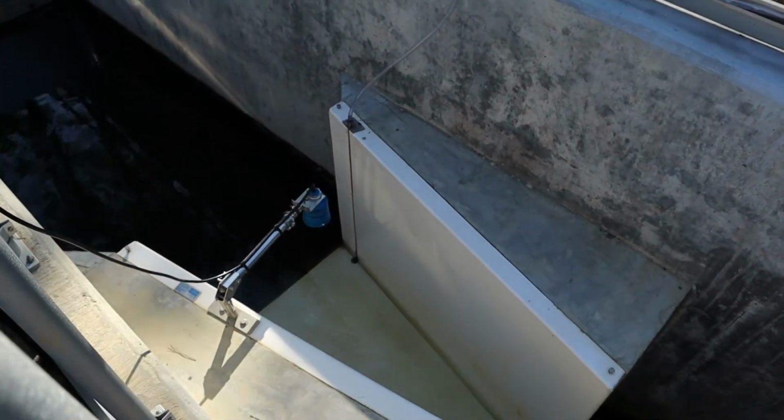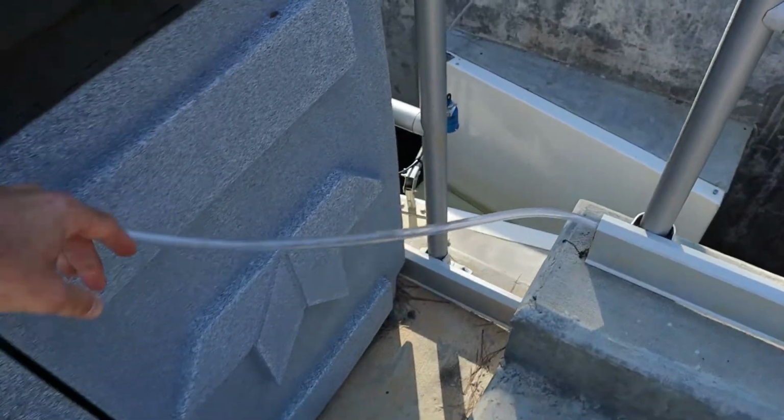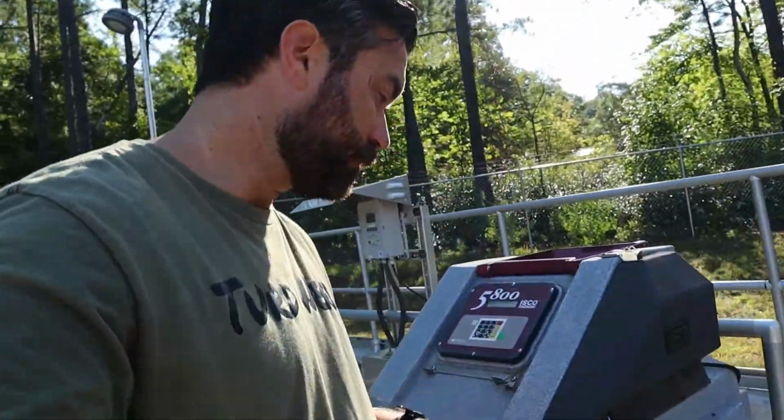You are working around wastewater, it's high nutrient. Our sampler goes all the way down to there, connects to that straw, and it pulls from the inside of our flume. So algae growth can happen in here, and that's part of what we're checking whenever we do turn on our sampler and we're making those checks. So I know the sun is harsh, I'm sorry, let me get you over here.